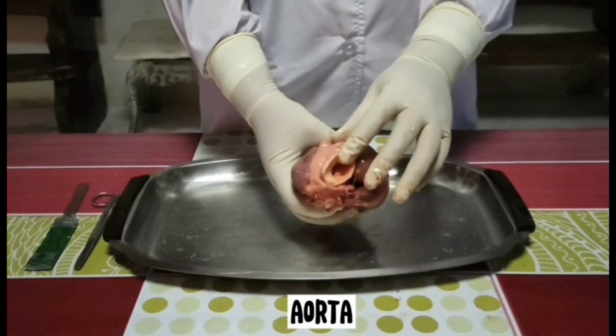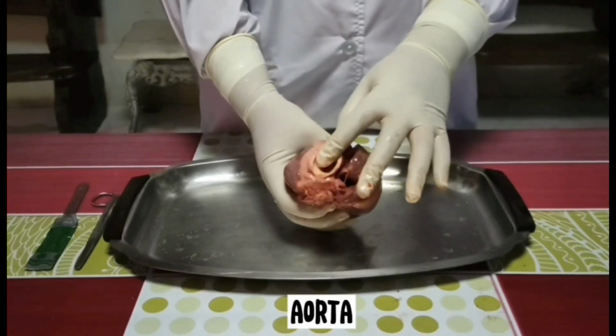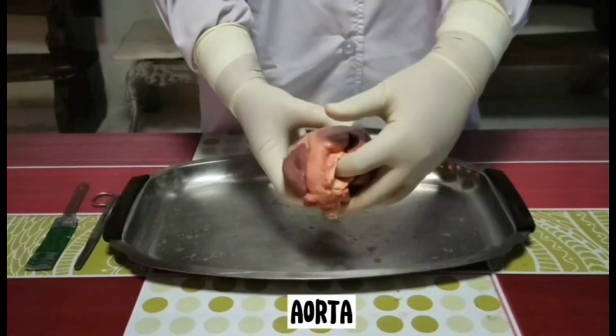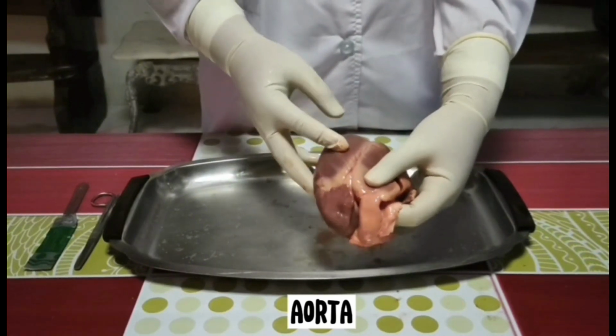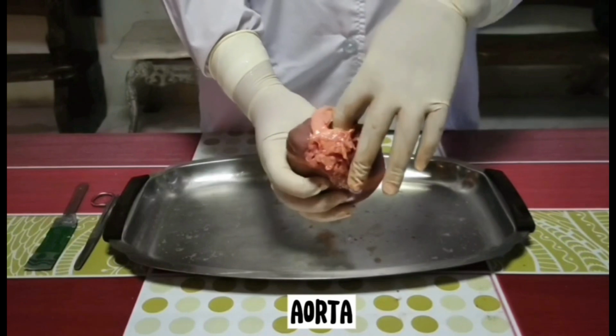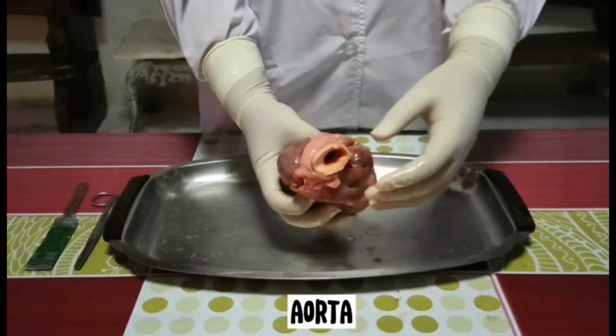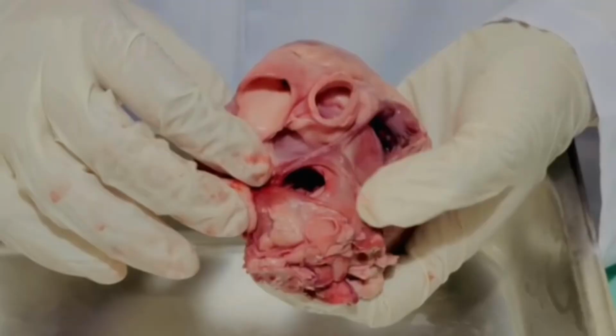And now, let's have the aorta. This is the major vessel located near the right atria and just behind the pulmonary arteries to the lungs. Locate the curved part of this vessel known as the aortic arch. Branching from the aortic arch is a large artery that supplies blood to the upper body.